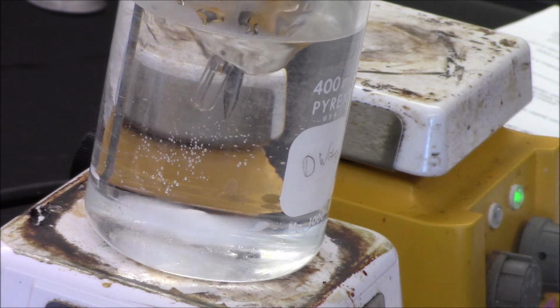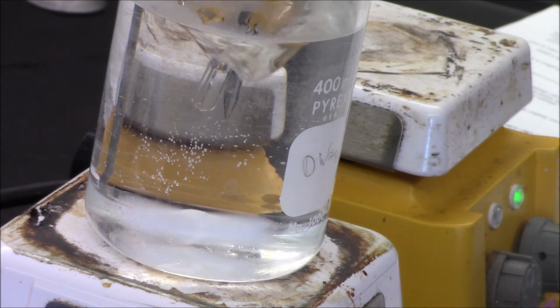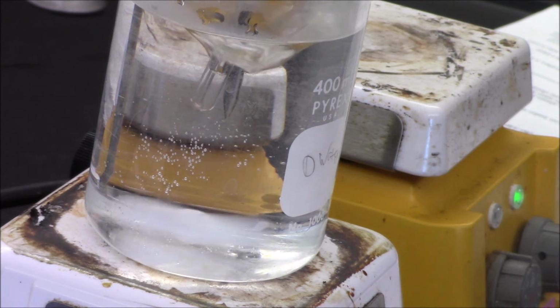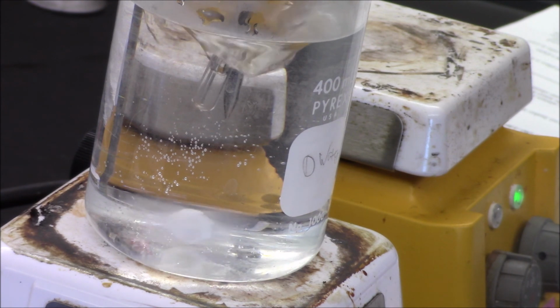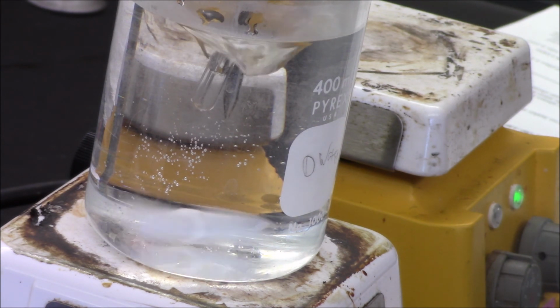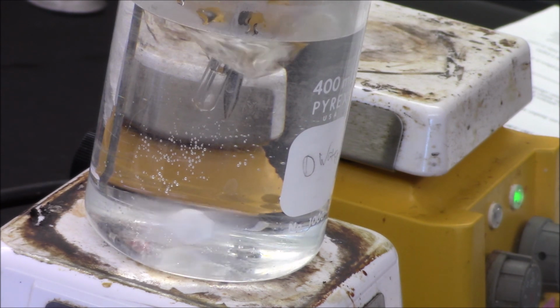52.6. You guys can still see that. I just hope that we don't run out. 52.3. Okay. Almost done.